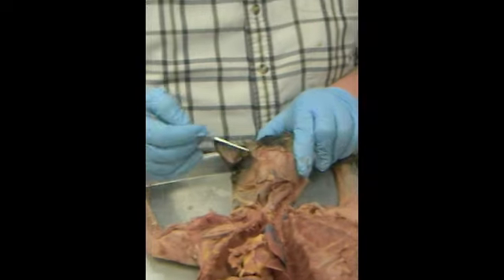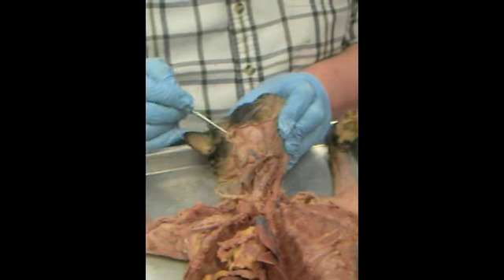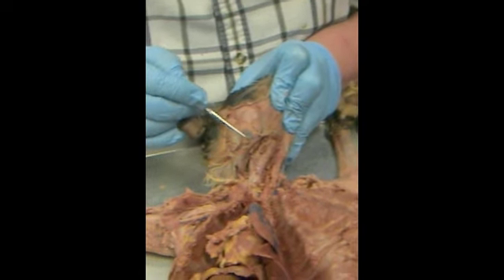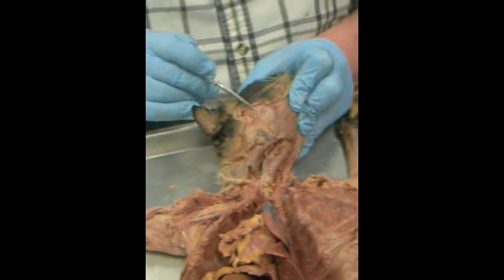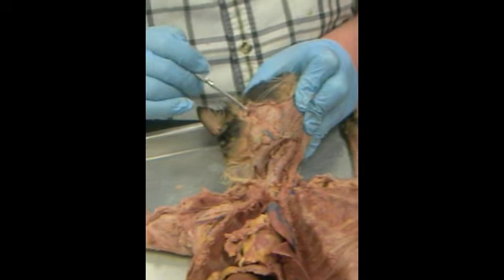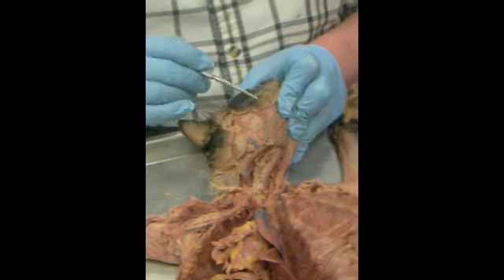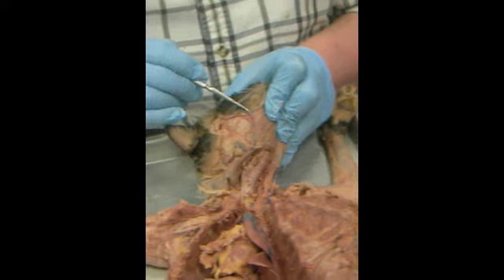I'll go slowly. We're here behind the ear. We have the parotid gland, this large gland right behind the ear. Right here below it is the submandibular. Then in here will be the sublingual. Coming across the cheek is going to be the parotid duct. A little higher would be the facial nerve. Coming down here would be the submandibular duct, because the ducts are on the outside. At the corner of the mouth is going to be called the molar gland.